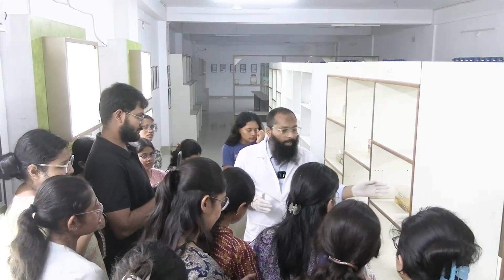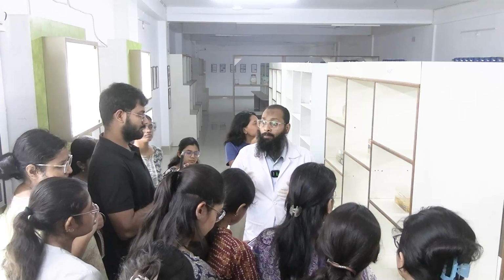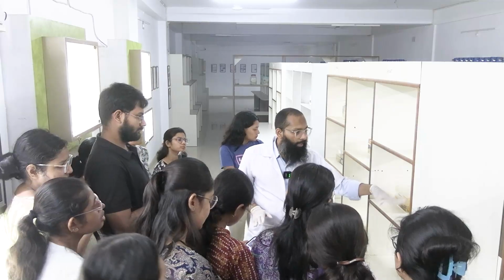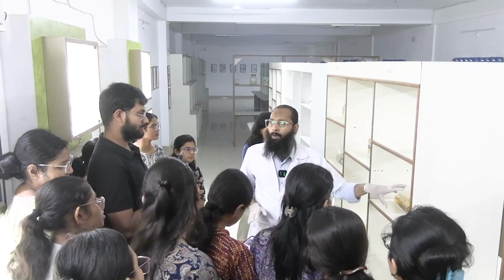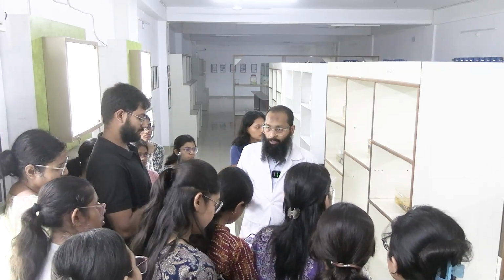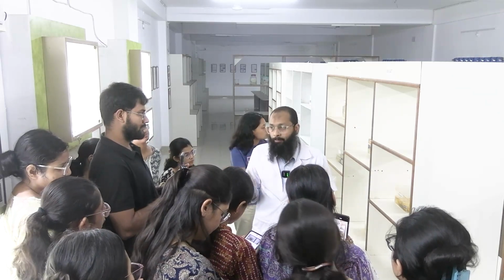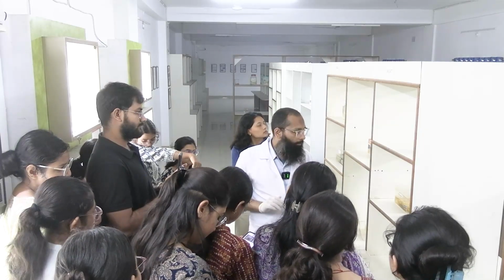If there is any special areas like any whitish or blackish or reddish area present, you can describe it. Here is nothing such. So this is probably a specimen of carcinoma breast. Probably, because we don't know whether it's a carcinoma or not unless and until we look under the microscope. So just say in that way.